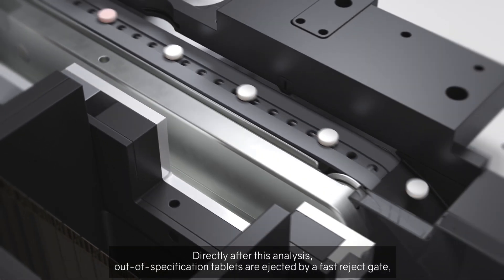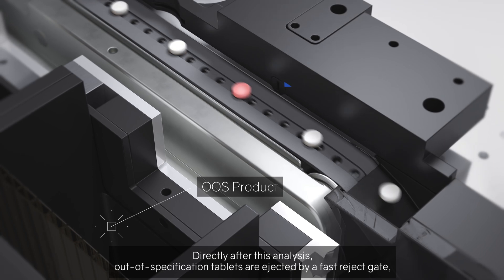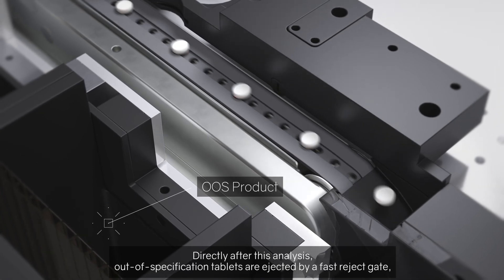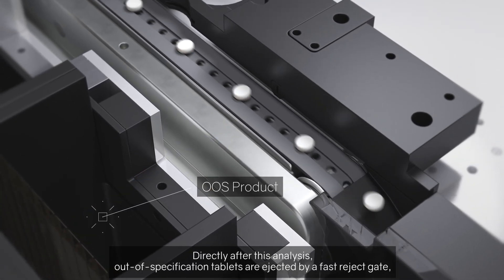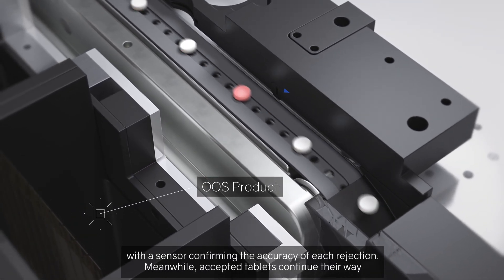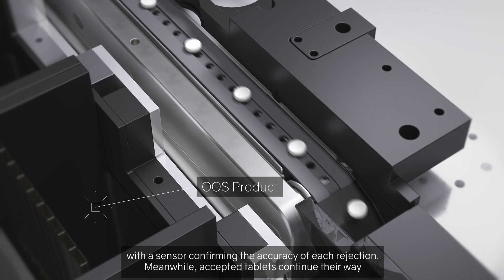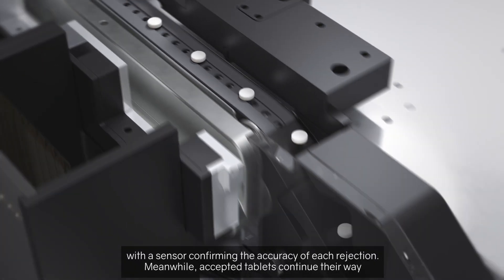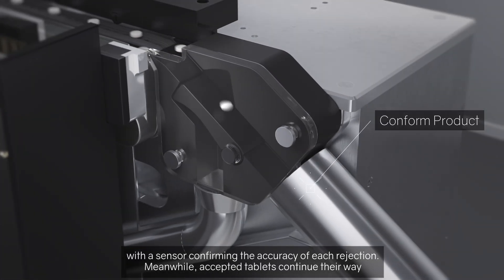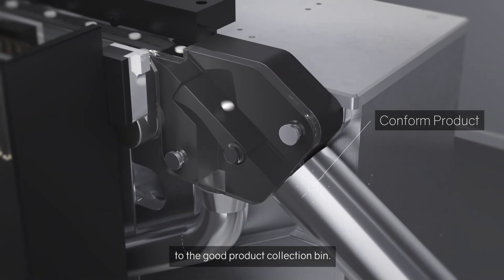Directly after this analysis, out-of-specification tablets are ejected by a fast reject gate, with a sensor confirming the accuracy of each rejection. Meanwhile, accepted tablets continue their way to the good product collection bin.